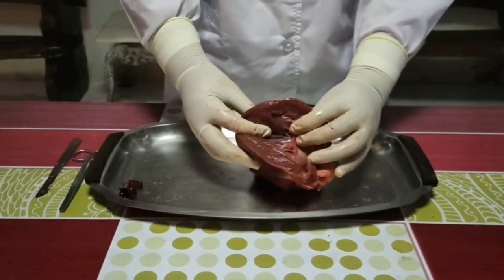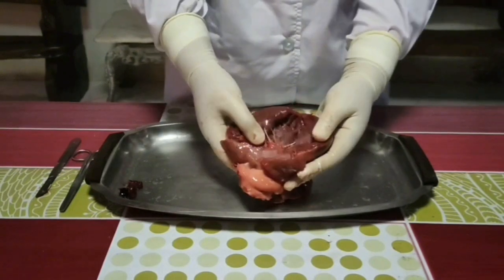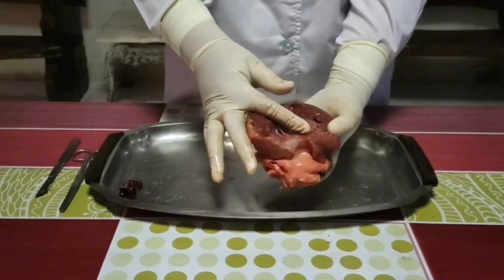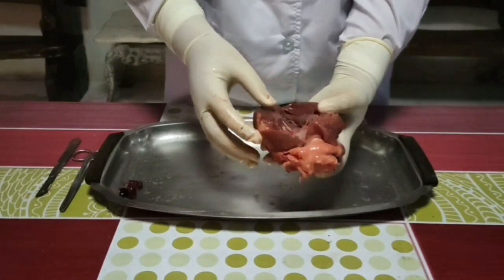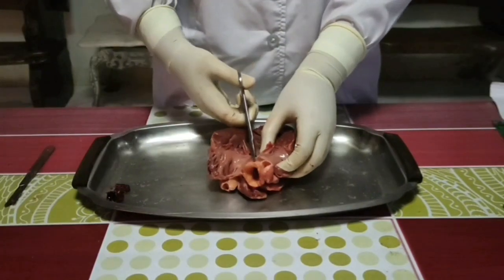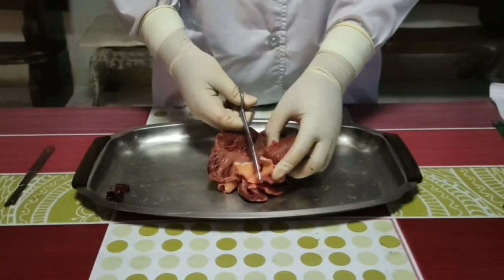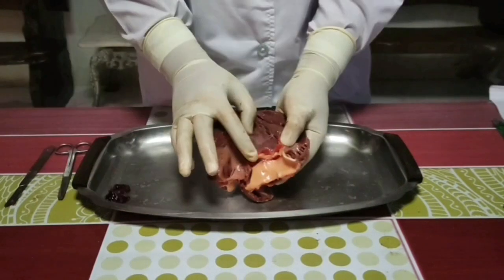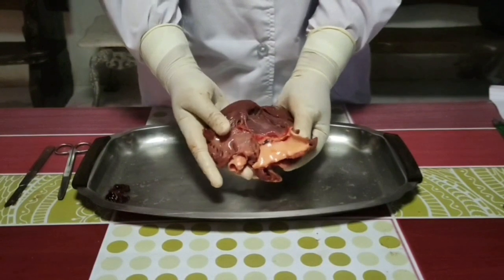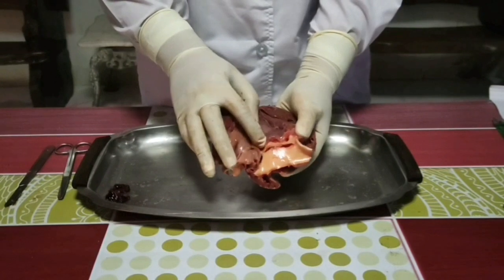Now let's examine the left ventricle. Notice the thickness of the ventricular wall. This heart chamber is responsible for pumping blood throughout the body. Using your scissors, cut across the left ventricle toward the aorta and continue cutting to expose the valve. Then count the 3 flaps or leaflets on this valve leading from the left ventricle into the aorta and note their half-moon shape. This is called the aortic valve.